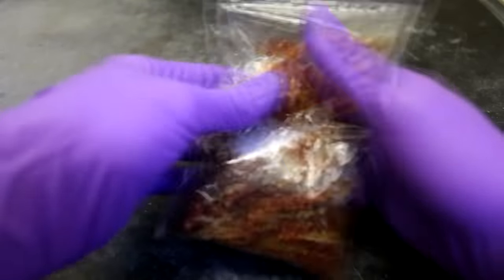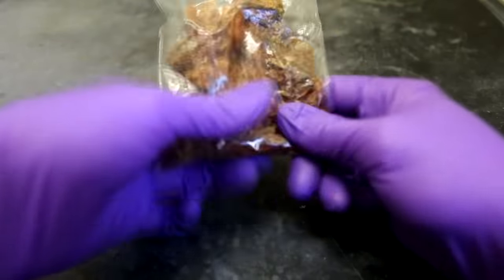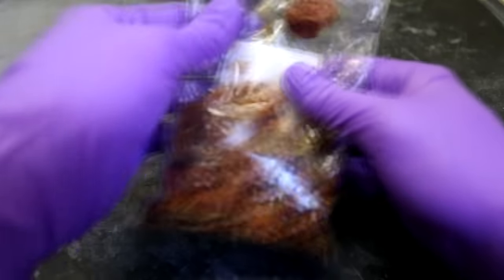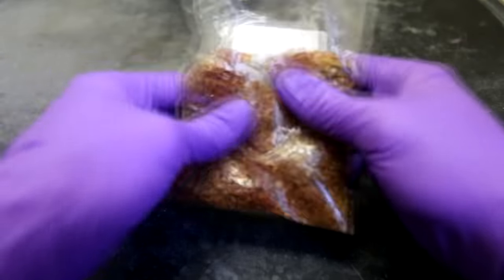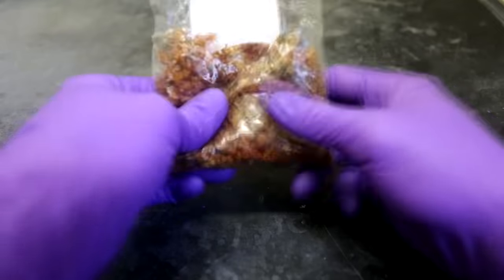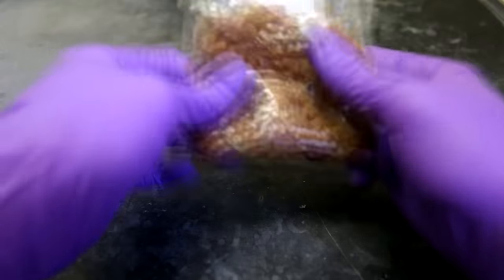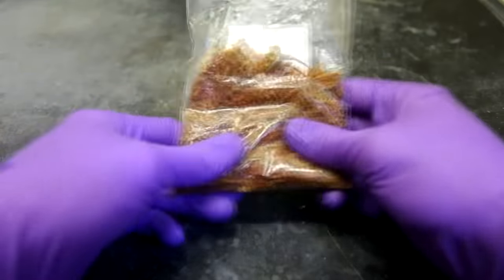First, with my hands, I crushed up the ghost chili peppers to break them up into as many pieces as possible. It is important that the peppers are as dry as possible, otherwise, along with the capsaicinoids, you'll be extracting a lot of water. Excess water will make drying the extract a much lengthier process.